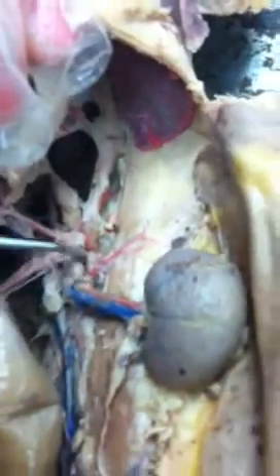This is the spleen, this massive thing. All right, this is your kidney. Leaving your kidney going to your bladder is called your ureter. Adrenal glands are a little messed up, but it's a little tiny gland right above the kidney. Your urinary bladder is this pouch, and your urethra is the tube leaving the bladder.